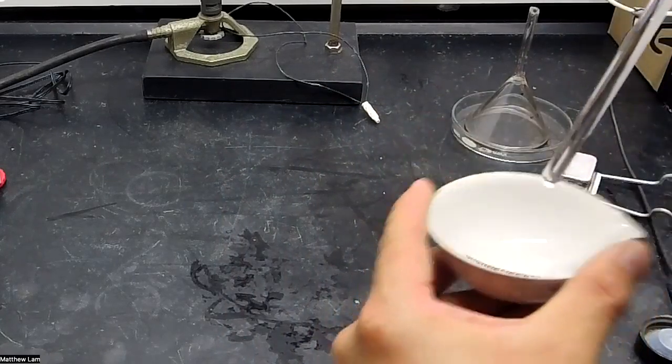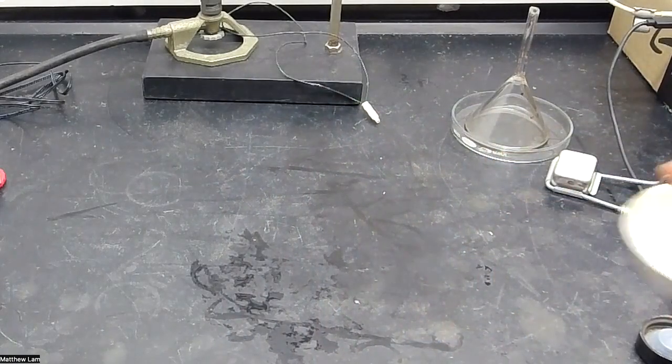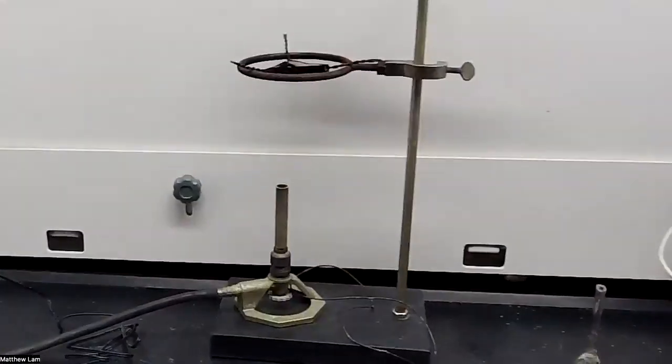It doesn't do it a lot of justice, but trust me, it helps a little bit more. So we'll take that and we'll add this to our apparatus in the back.